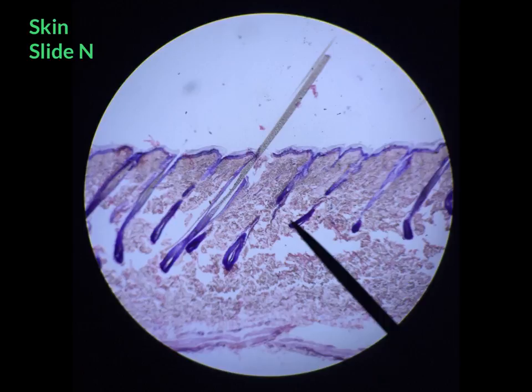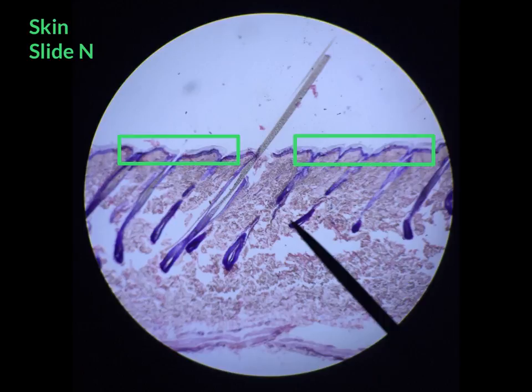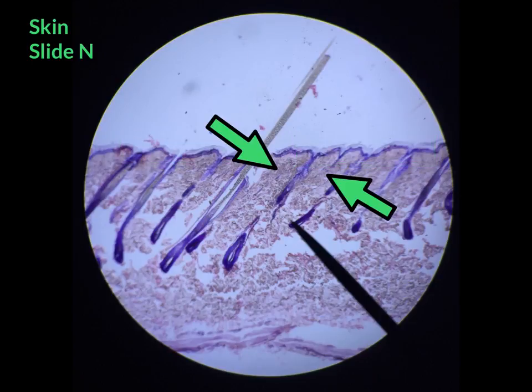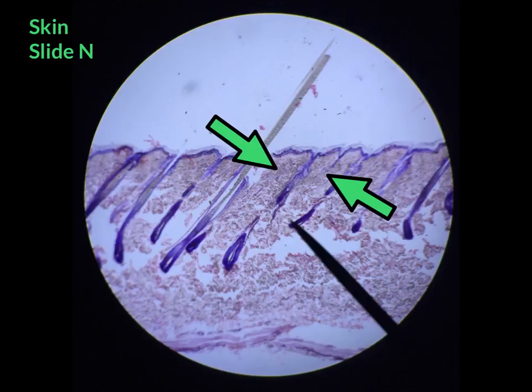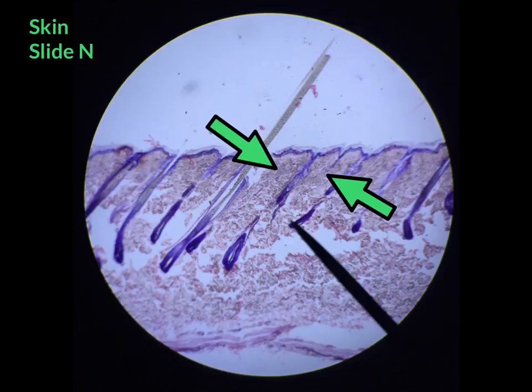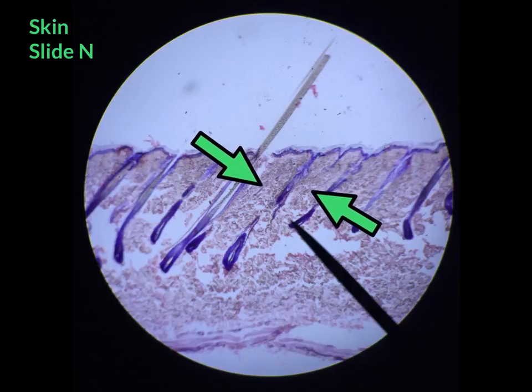In a previous video while looking at the skin we studied stratified squamous keratinized epithelial tissue. Underneath that tissue is dense irregular connective tissue, which is shown here in a light brown-pink color.